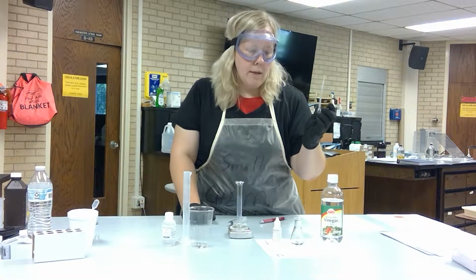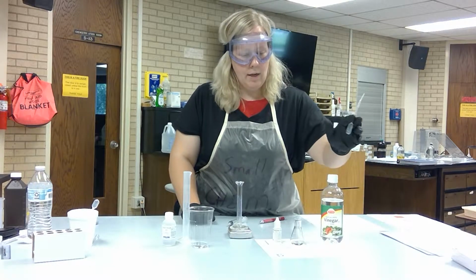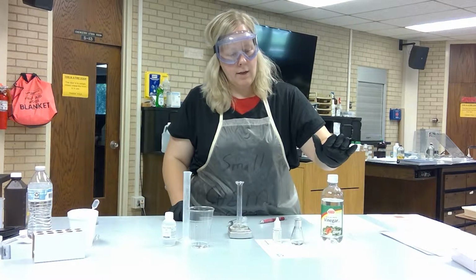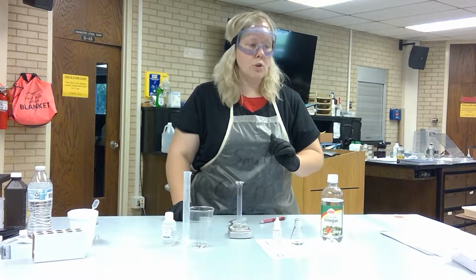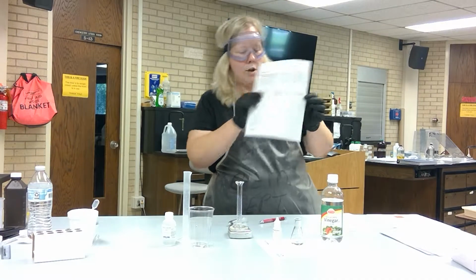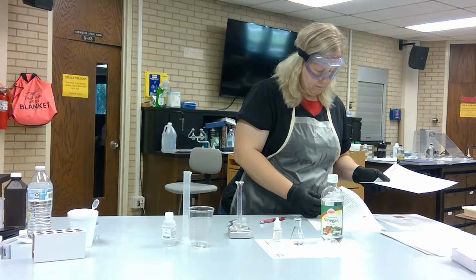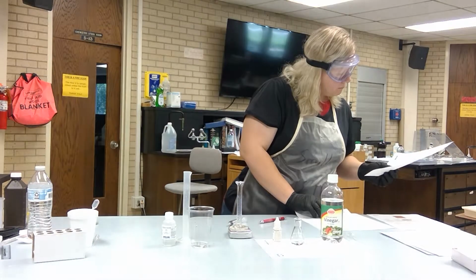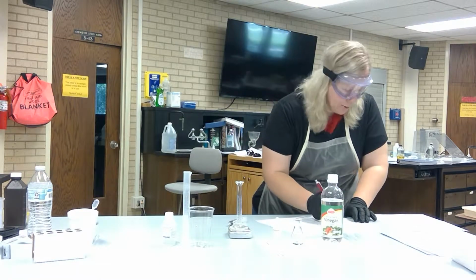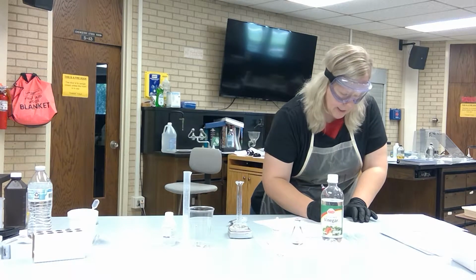You will need a pipette. That was not listed in the materials section, but it will make transferring the vinegar to your graduated cylinder much easier. Add 5 milliliters of vinegar to the graduated cylinder, and make sure that you get the exact mass. And you are going to record that on data table 2. Oops. Actually, sorry, data table 1. Data table 2 is for your vinegar sample of your choosing. So I'm going to go ahead and put this on data table 1.